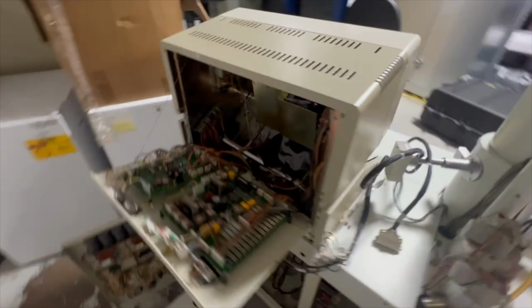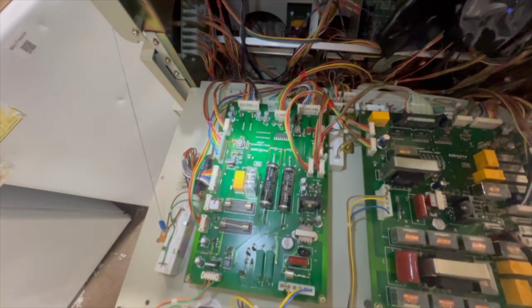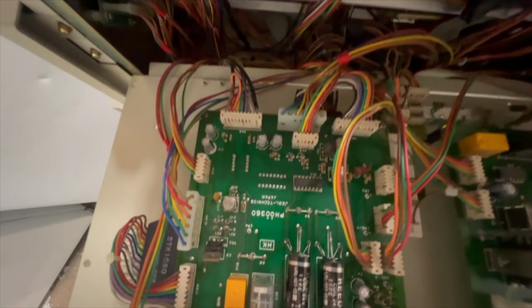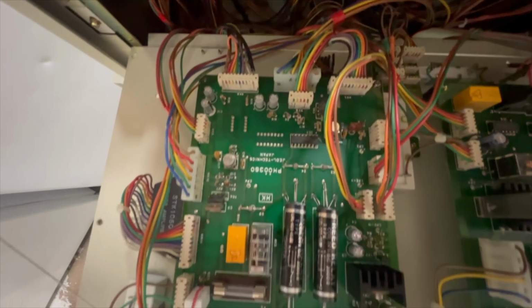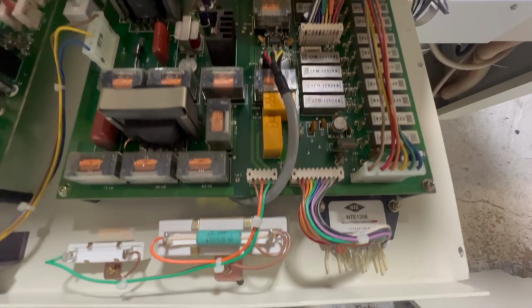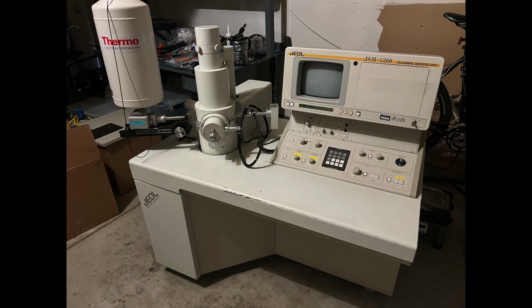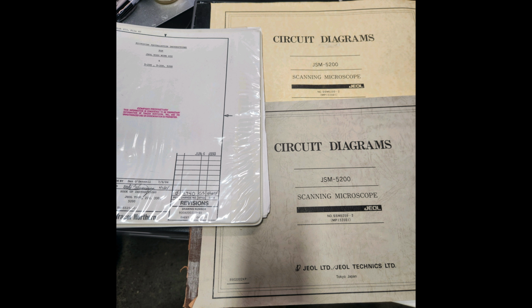The lab selling it told me that they tried to repair it themselves, but got nowhere. So they promptly stuck it in a warehouse and forgot about it for 10 years. I declined to buy it, but I told them if they ever wanted to scrap it, I would gladly take it off their hands for free. 6 months later, and to my complete surprise, I got a call back from the same lab. Apparently, no one else had been interested, so I got a friend and a truck and went to pick it up, along with a box of manuals and schematics.